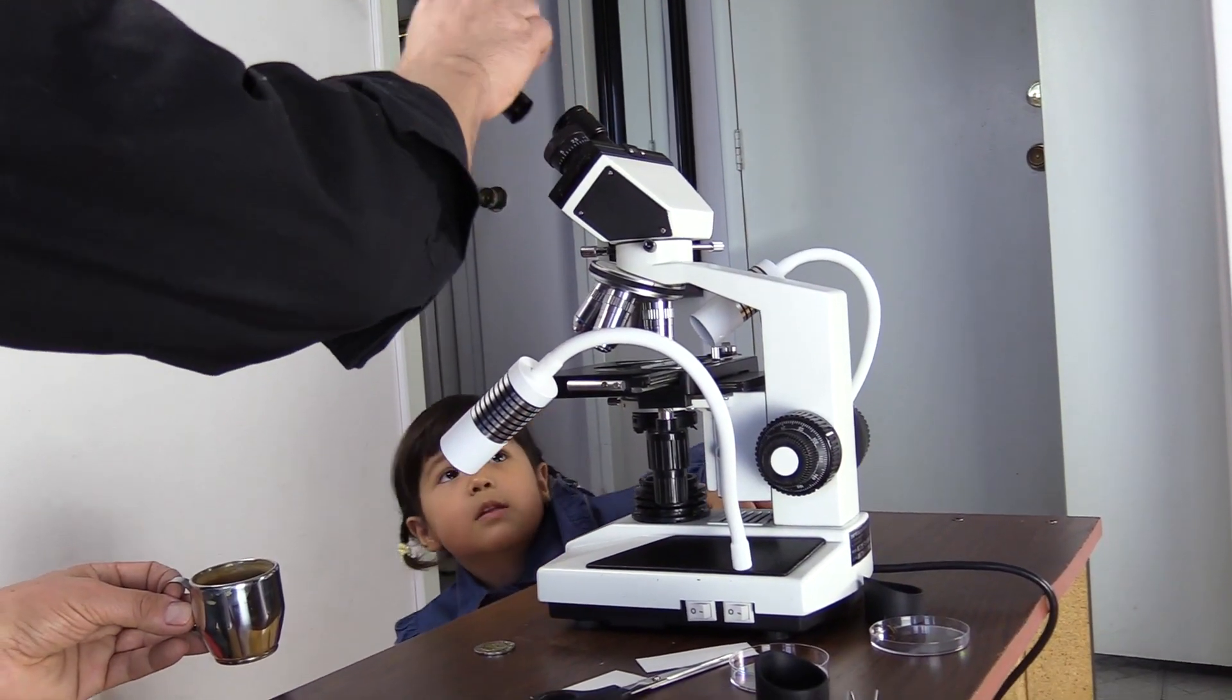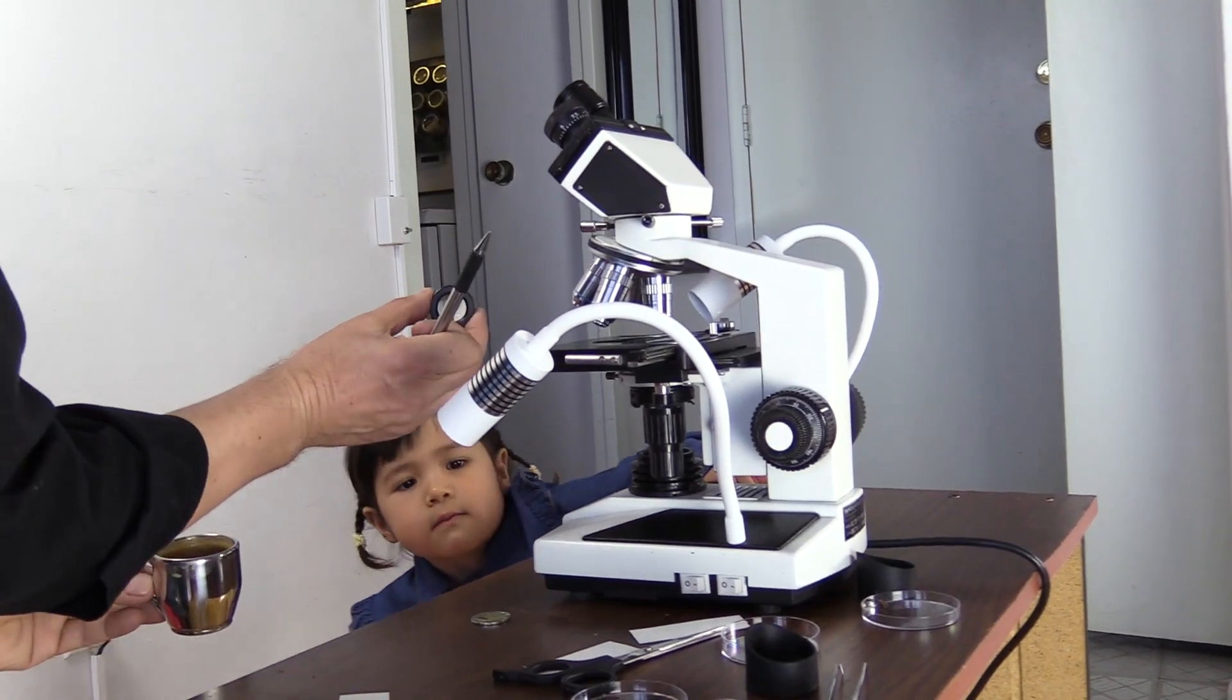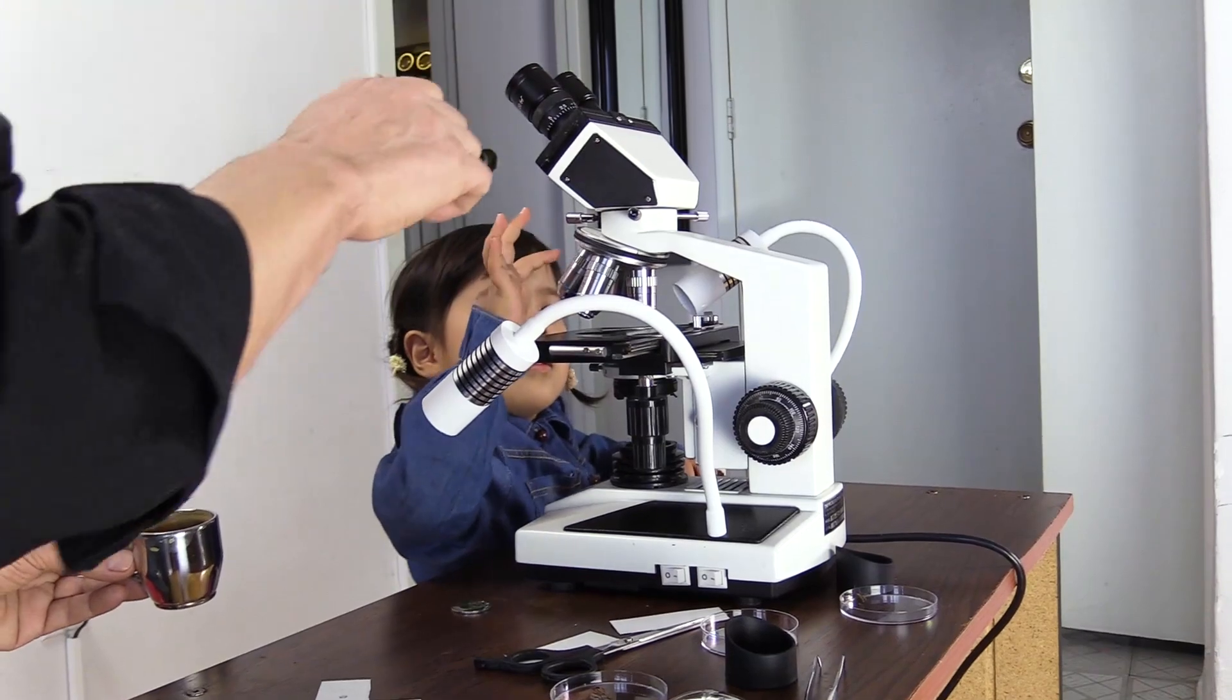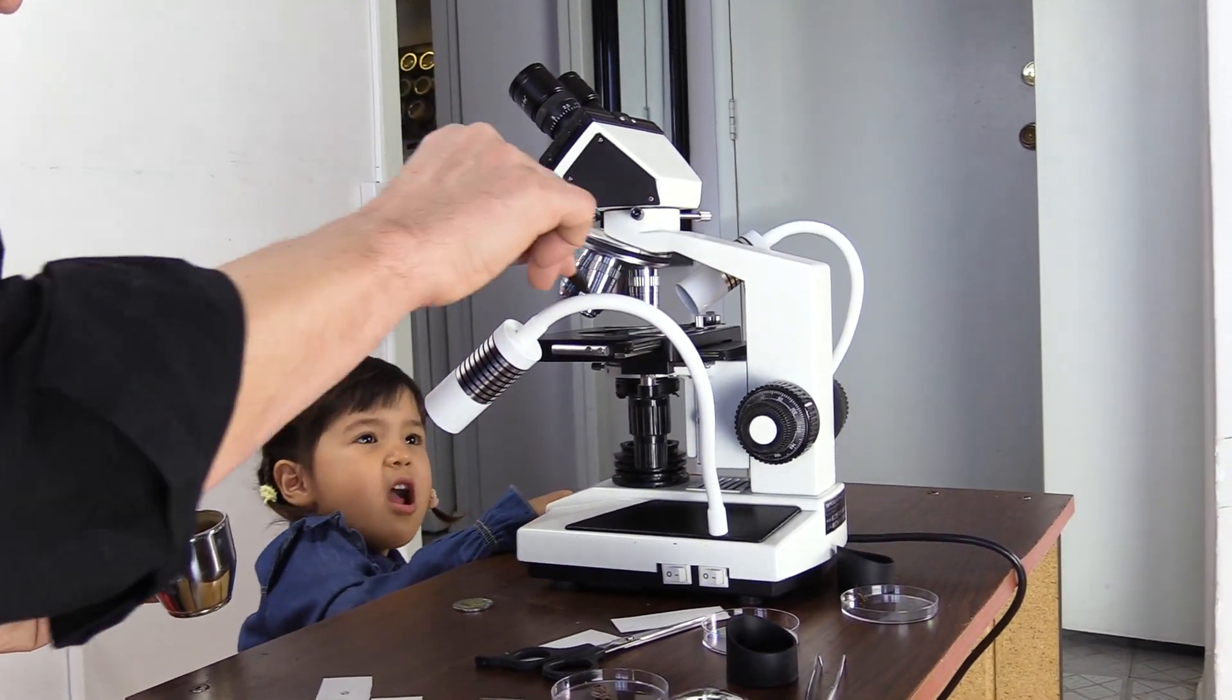When your new microscope has arrived, set up several different objects and petri dishes to view. You can start with sugar, salt, flour and sand.